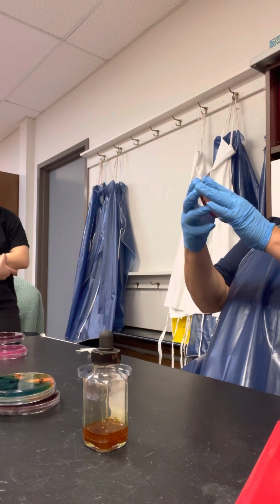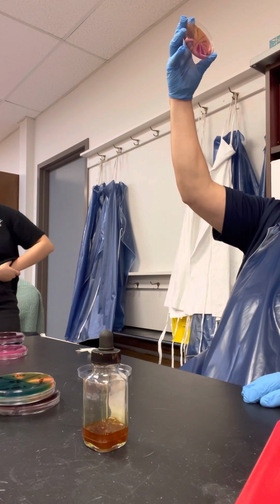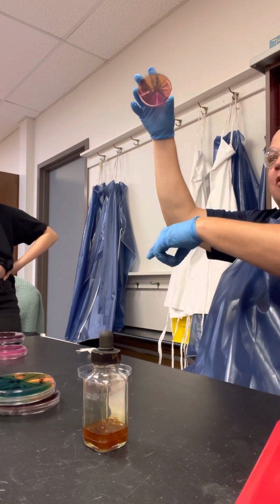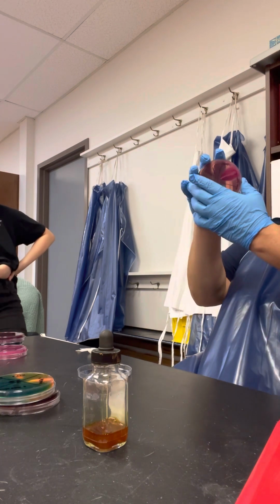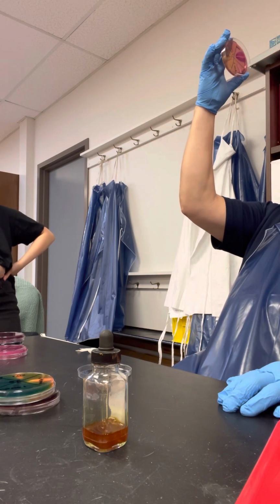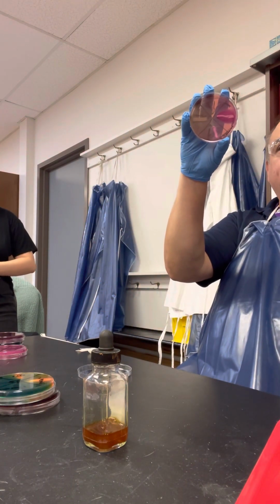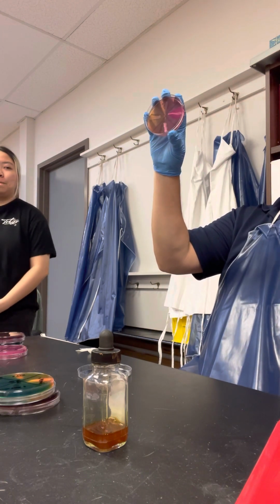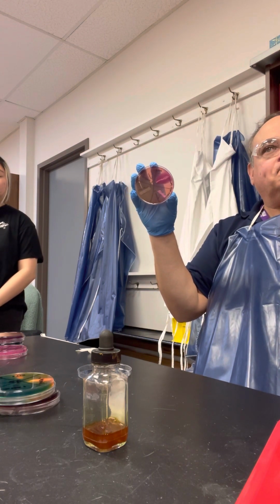There's another organism that's growing in here that has no color, right? So that's a lactose negative or a lactose non-fermenter. That's Salmonella. Salmonella looks like this here, but it looks black over there, right? So you can see how these things are used. And then the other one here is Enterococcus faecalis, and that's just scratch marks that people put on there when they were inoculating. Enterococcus faecalis is a gram-positive organism. Does it grow on this plate? No, because this plate is specifically selective for gram-negatives only. And then it differentiates based on the gram-negative's ability to ferment lactose, okay?